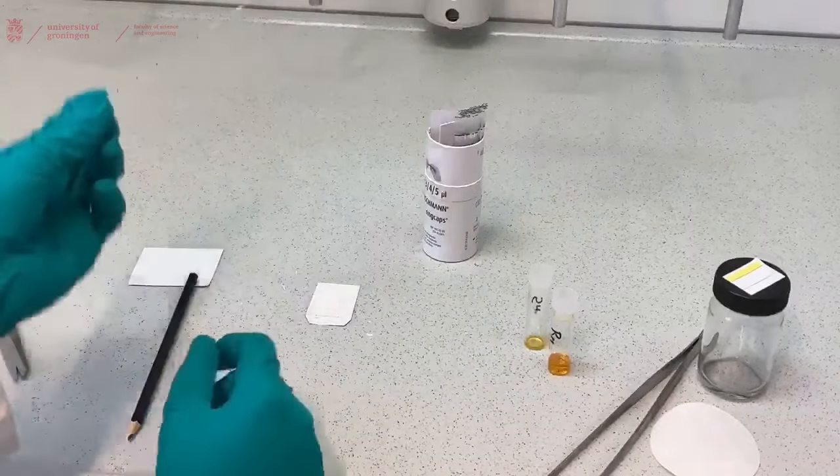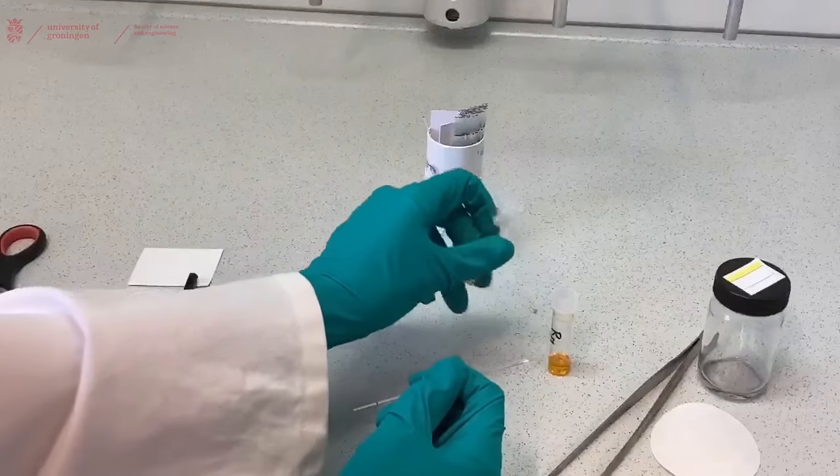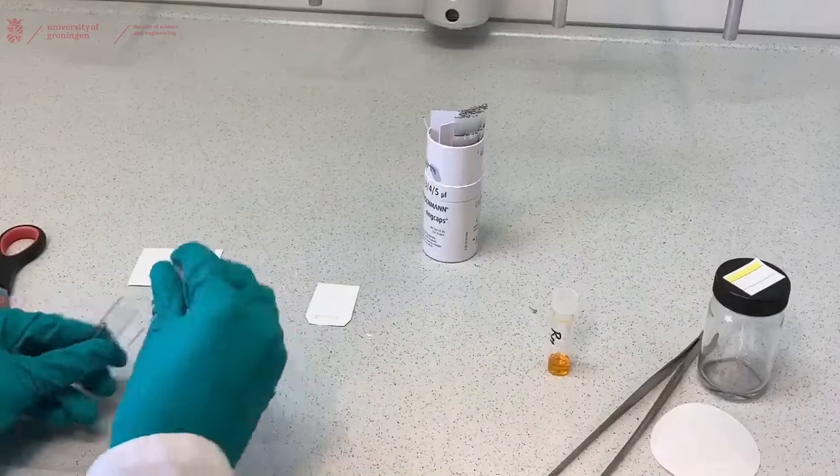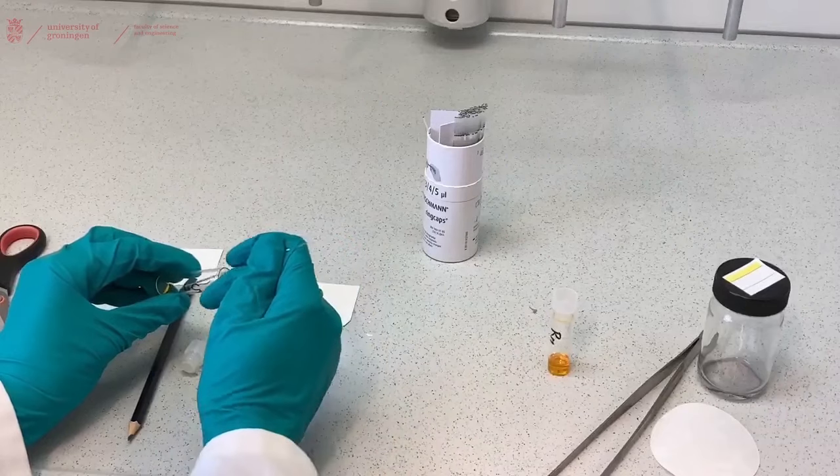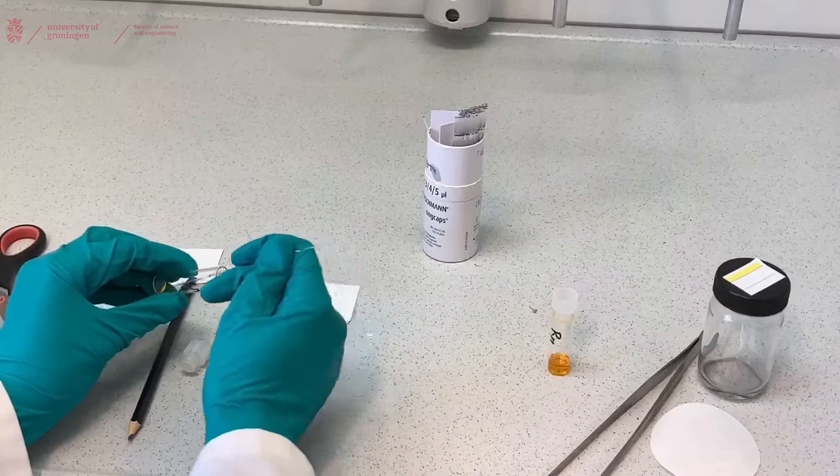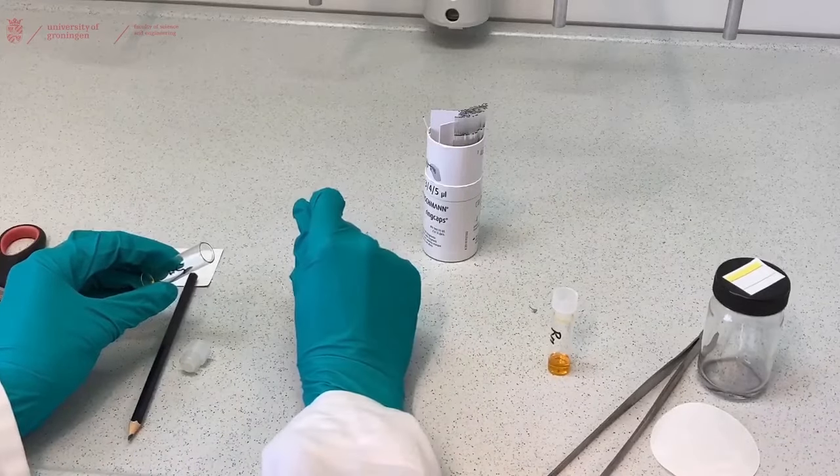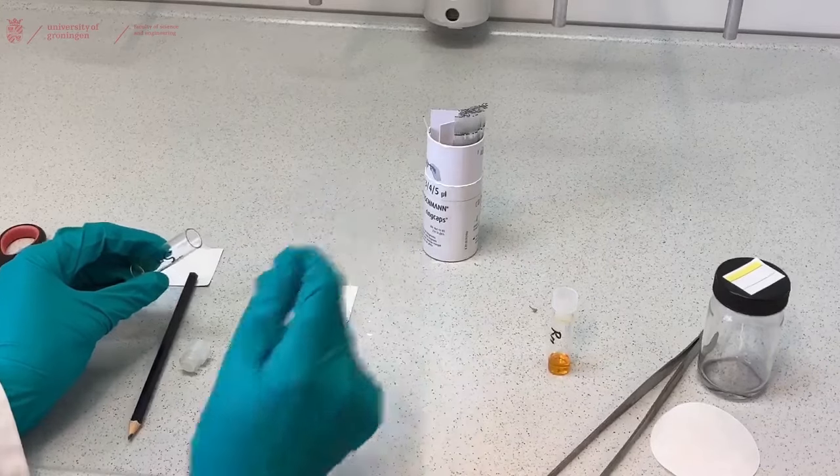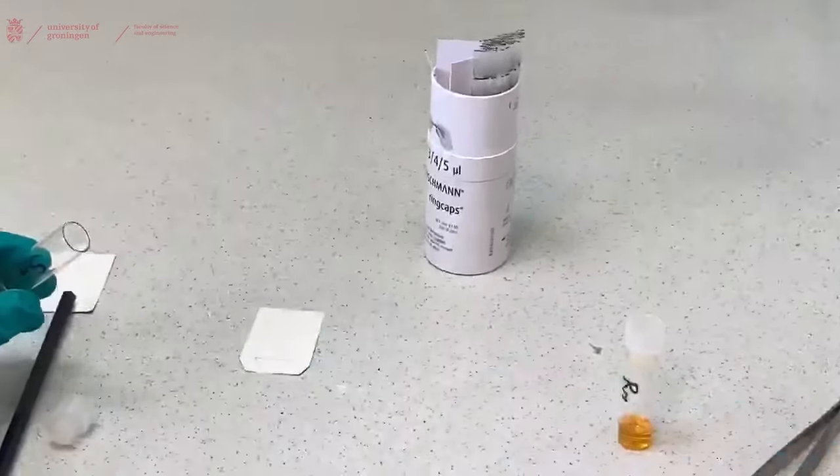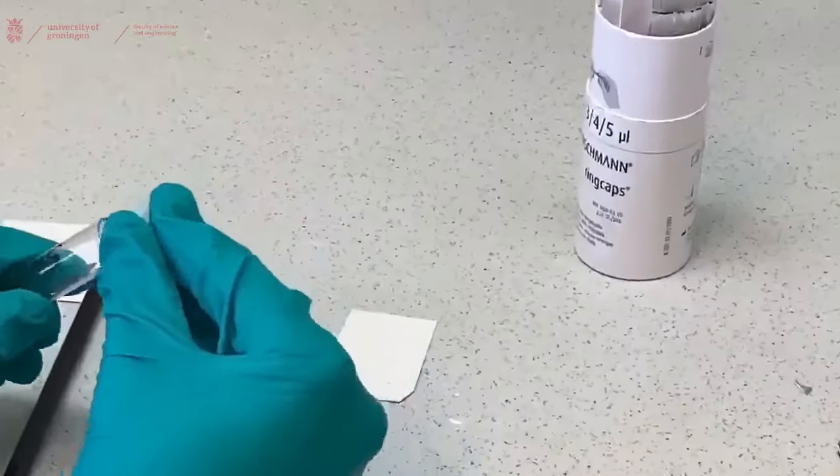Take a capillary and take our starting material. You just have to place one small dot. That's just more than enough. And then you can close it.